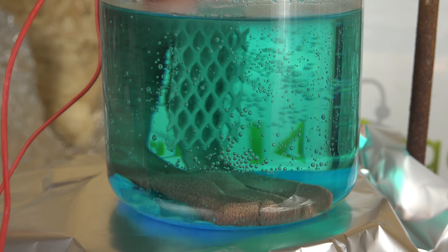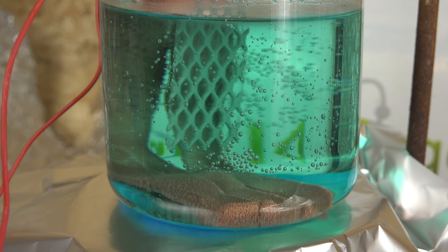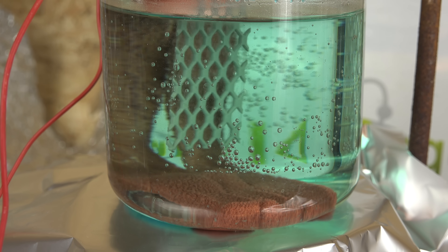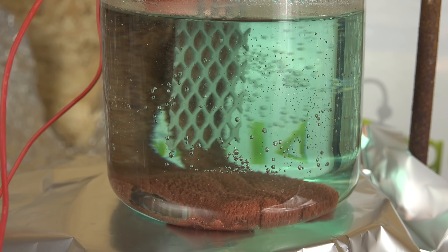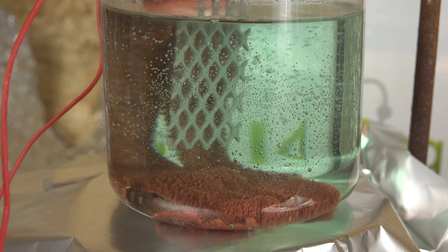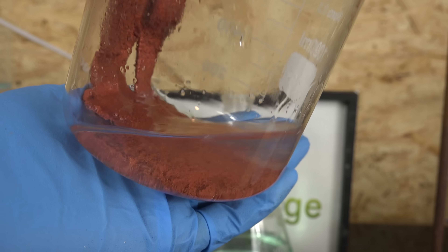As we progress, the copper sulfate will be consumed as it's converted to copper and sulfuric acid, and the sulfuric acid concentration will increase. Eventually most of the copper sulfate will be consumed and the copper cathode will start electrolyzing water and generating hydrogen rather than depositing more copper. I actually recommend stopping early when most of the copper sulfate has been dissolved but not all of it, because if we continue to electrolyze when there is very little copper in solution, the deposited copper will be very loose and spongy rather than a solid mass. And there we go — we're now generating hydrogen as there is too little metal left to deposit. We have to stop here. Now we carefully decant our solution to a flask for boiling. It also helps to wash the copper with some water to clean off the residues. You can see here the copper powder sloughing off the electrode.